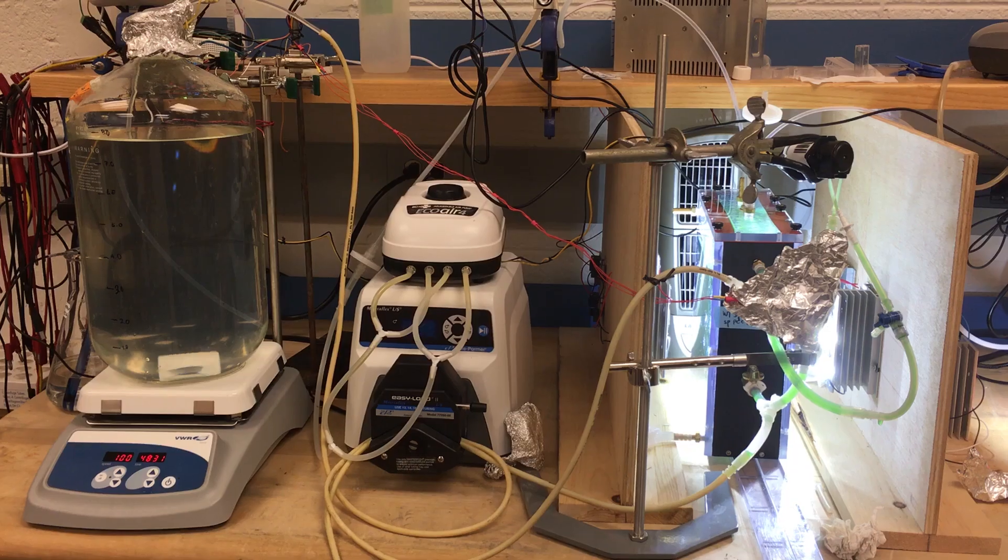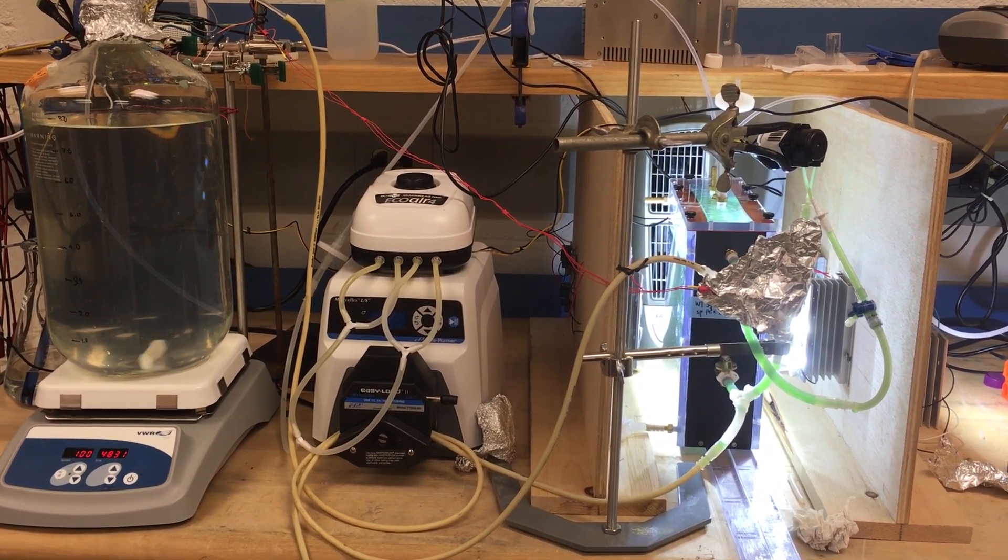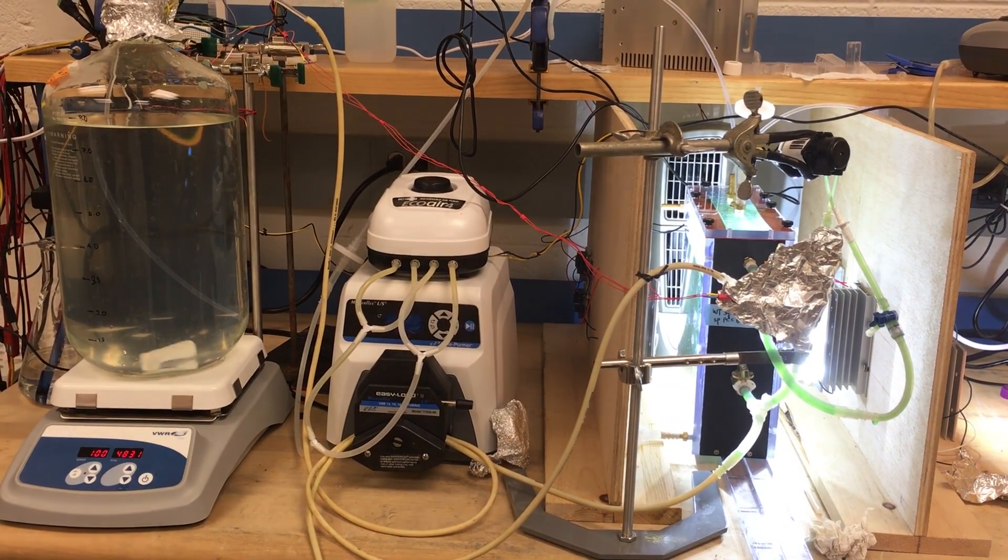How everyone is doing? In this video, I would like to make very brief walkthroughs of the setup for photobioreactors.